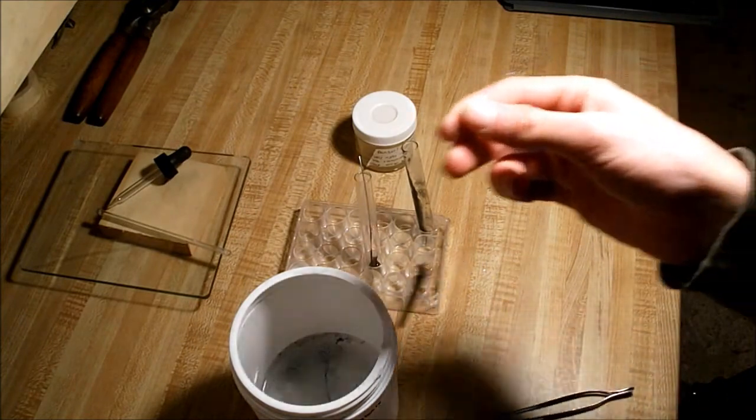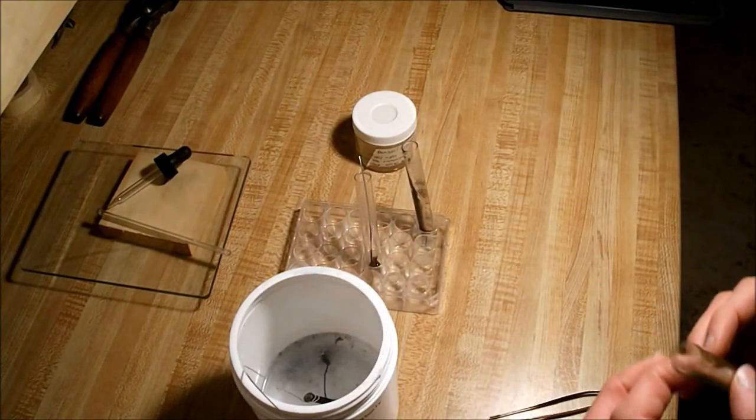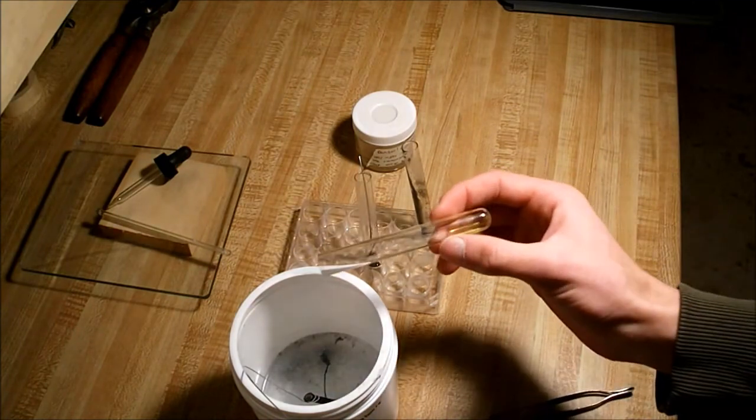Next remove the nail, drop that in there, and then drop in your iron two chloride.